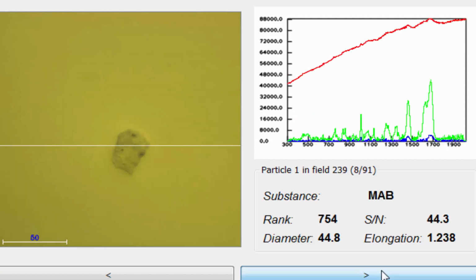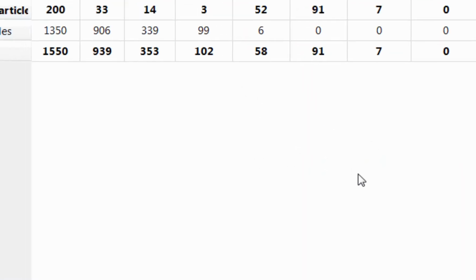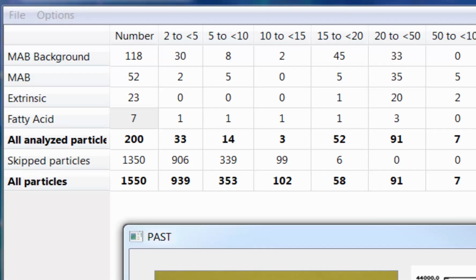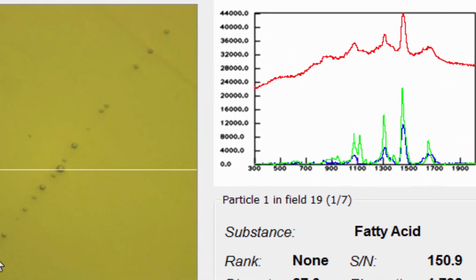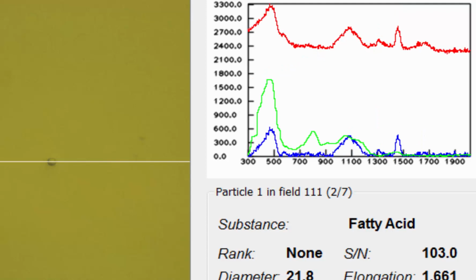In this experiment, what was very interesting was the fatty acid particles. There were in total 7. When it comes to these fatty acids, you could see that on the wet dispersion aid bottom, they form these straight lines, which is kind of a surprise, but that's how they orient or organize themselves in the wet cell, and you can now clearly see them.